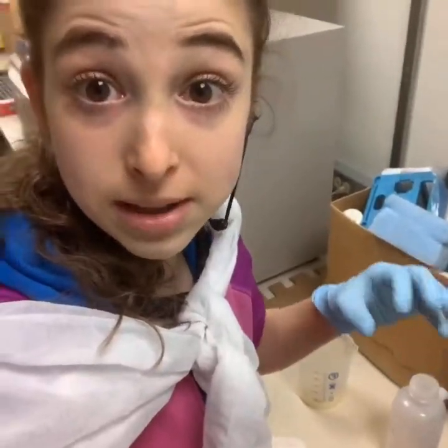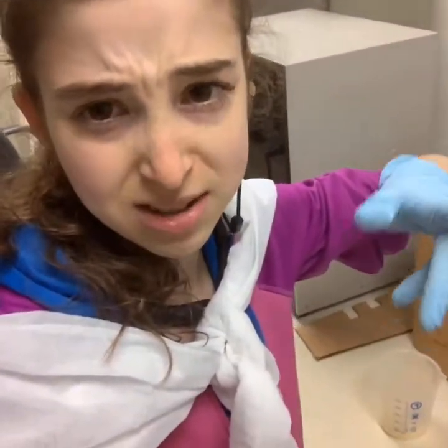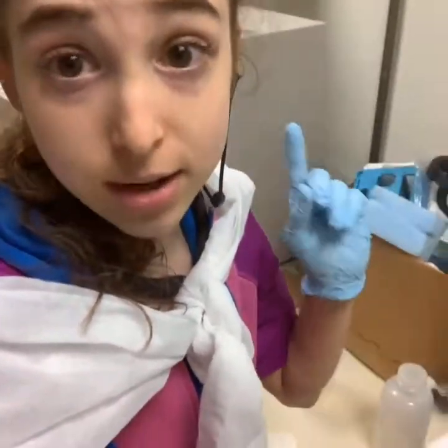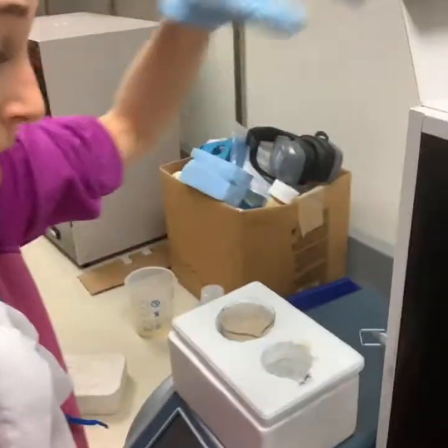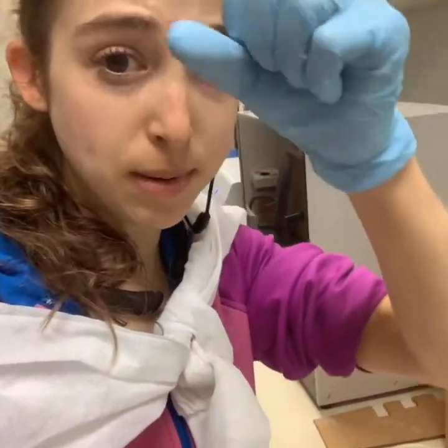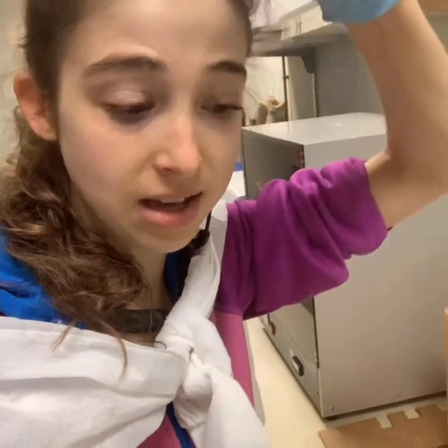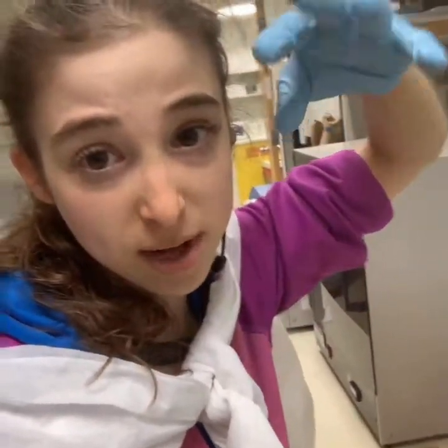To help with breaking them open — and also to shear the DNA, basically shred up the DNA so it doesn't interfere with protein purifying because it gets all gloopy — I'm using this thing called an ultrasonicator. This is a probe tip ultrasonicator. You can see this probe here, and it basically works by making all these little bubbles in the liquid, and those bubbles burst.